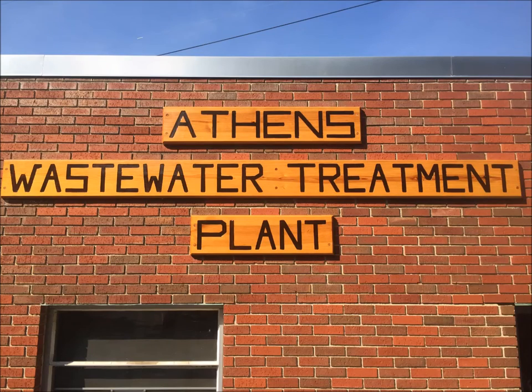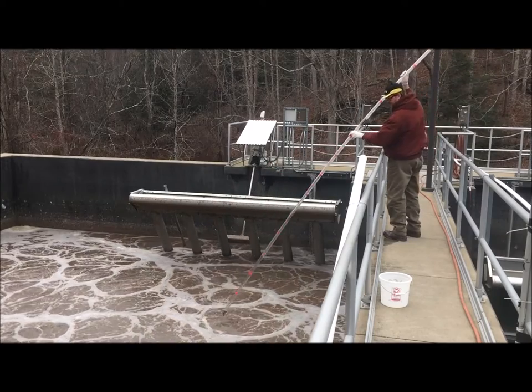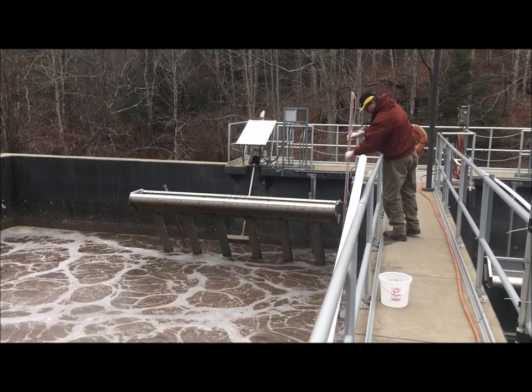Hello everyone, welcome to another video brought to you by the Town of Athens Wastewater Treatment Plant. Today we show you some process control testing to see how our plant is running.